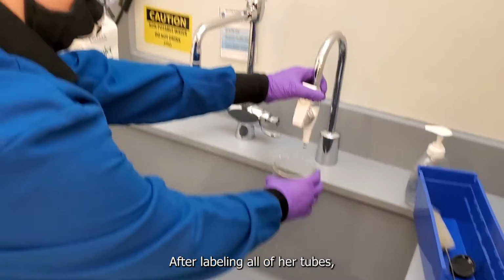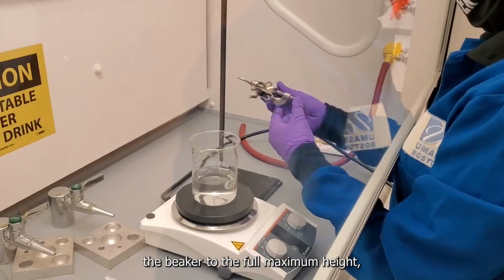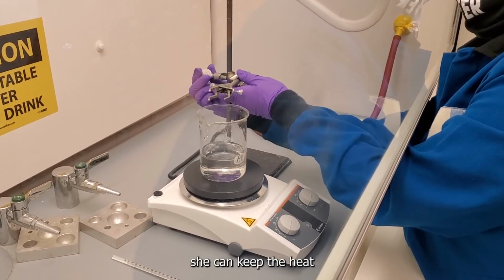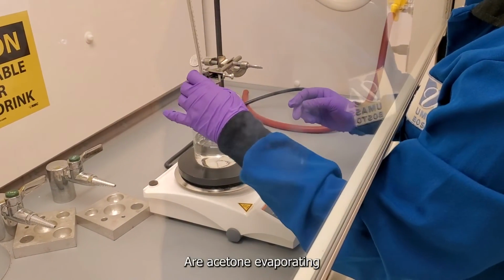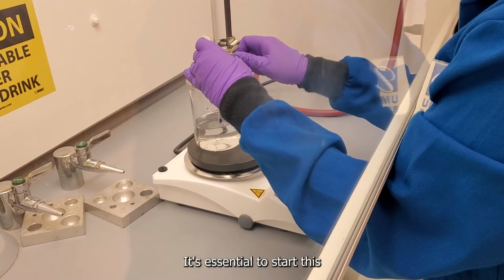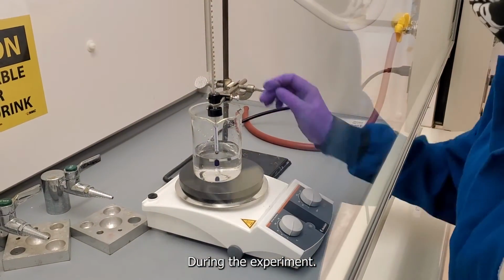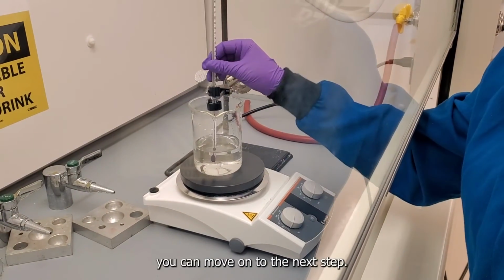After labeling all of her tubes, Tara is getting water to set up the water bath. Ensure that you don't fill up the beaker to the full maximum height, as you don't want to risk water getting into your tubes. Here, she is setting up a rack to hold up the thermometer to ensure she can keep the heat at a reasonable rate, because if we heat it too much, we can risk our acetone evaporating in one of the reaction mixtures. It's essential to start this before doing the reactions, as we will need the temperature to be at the right temperature during the experiment. Once this is set up, you can move on to the next step.